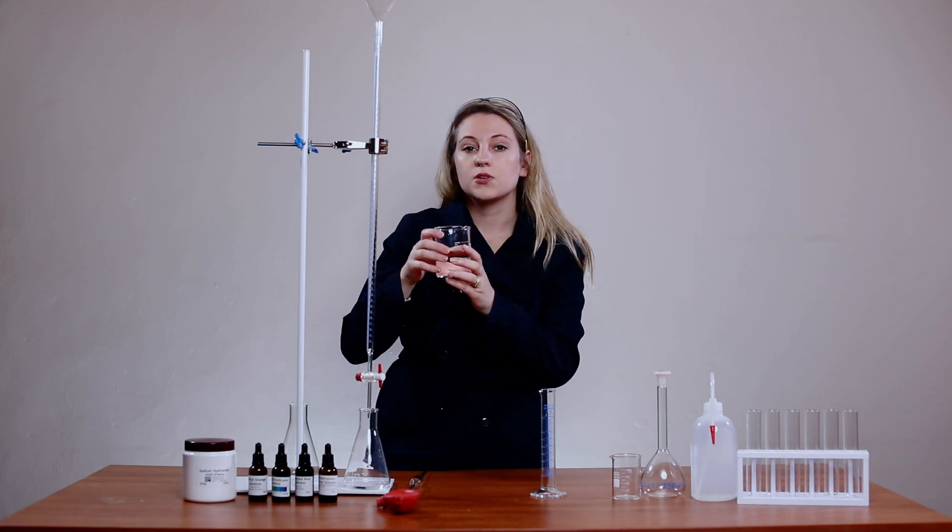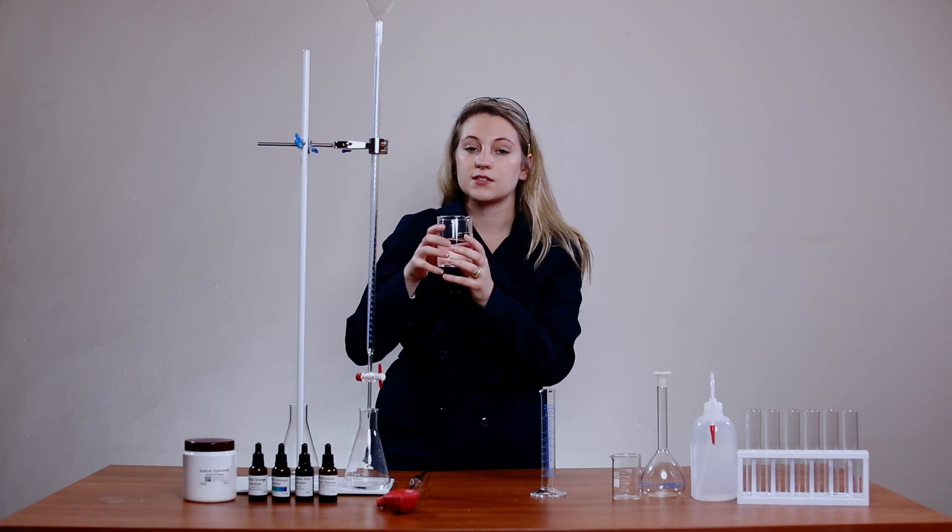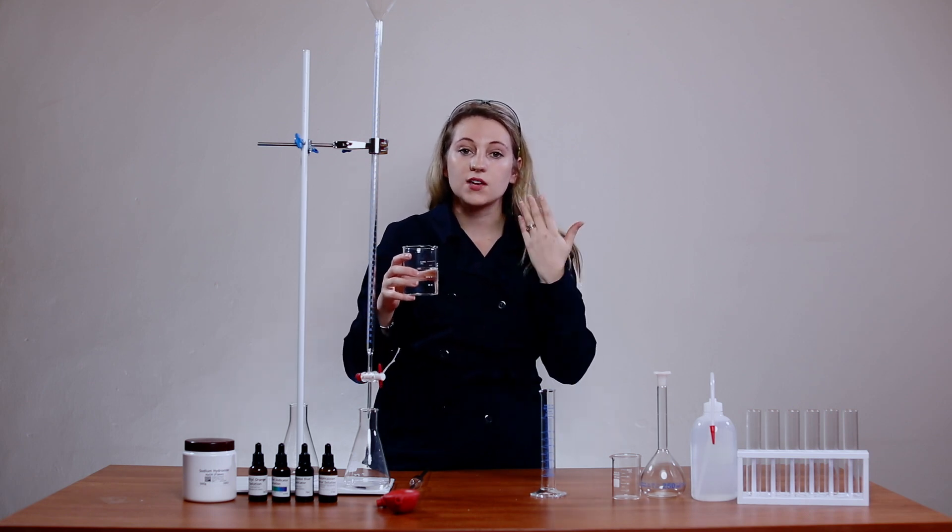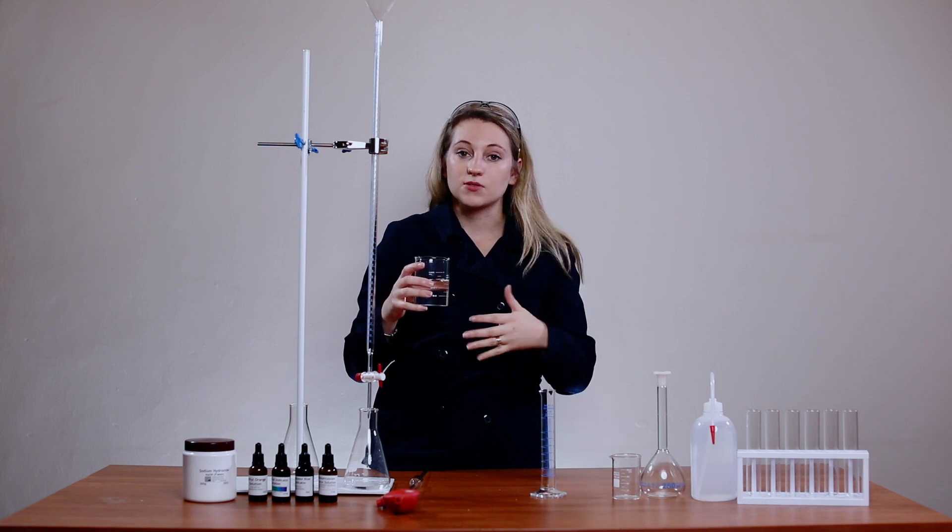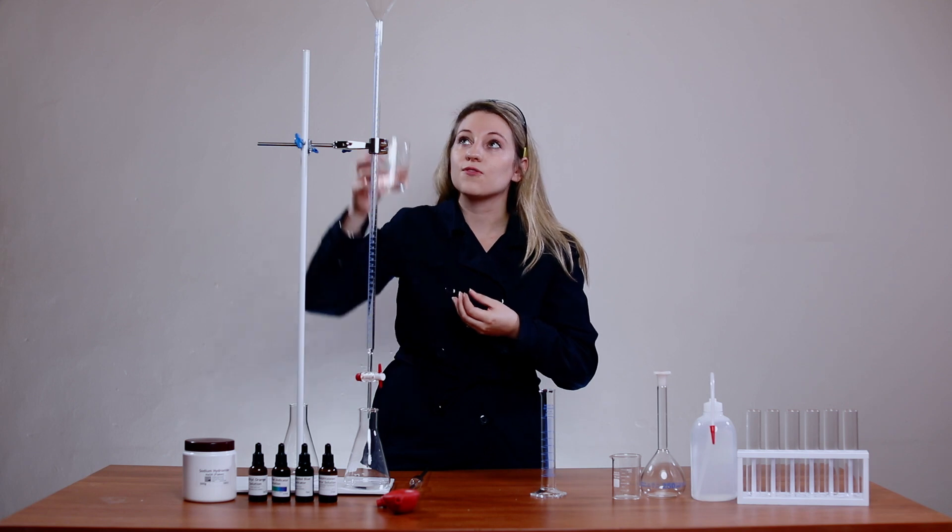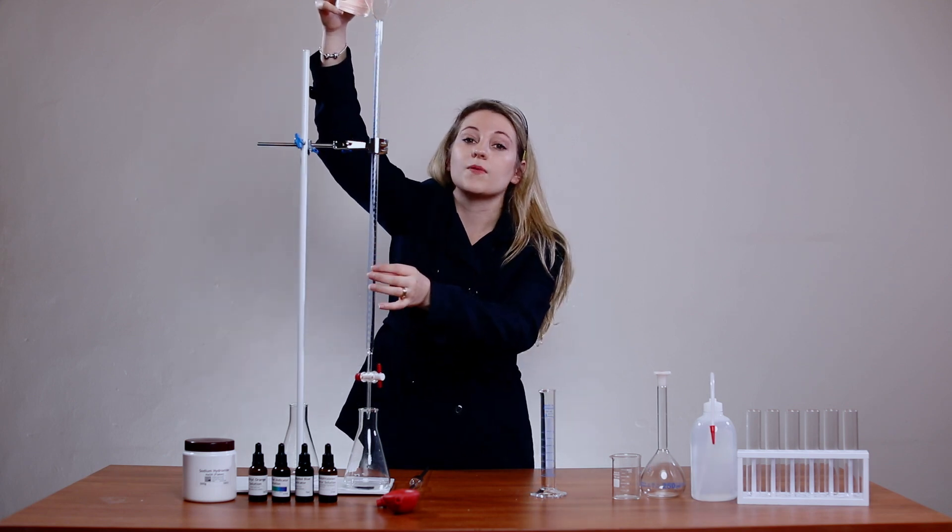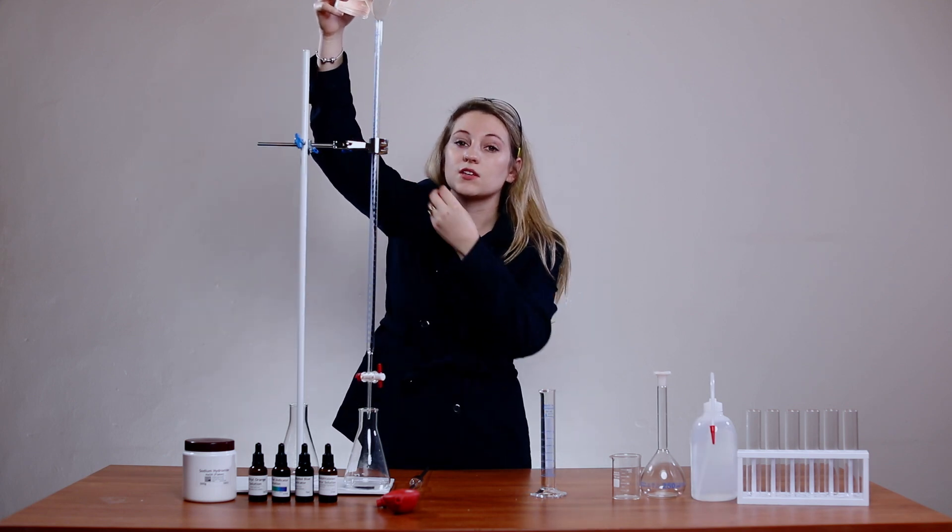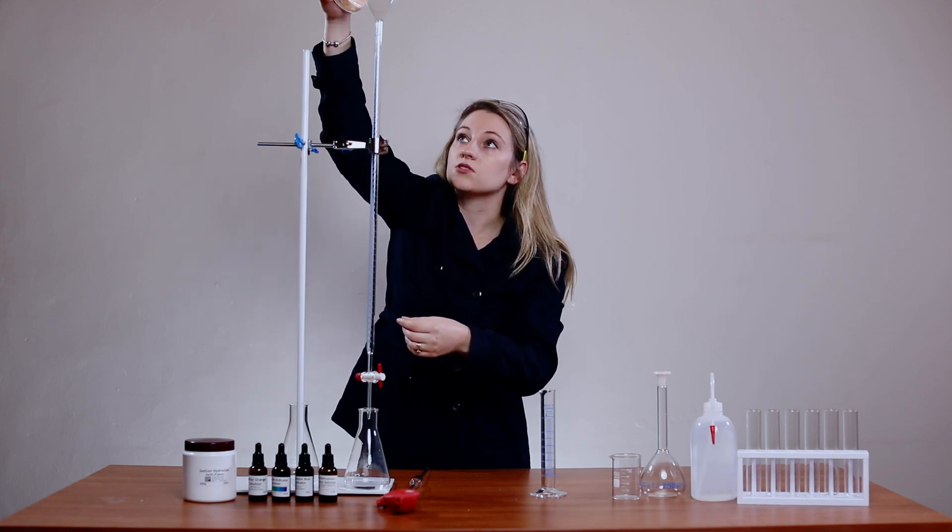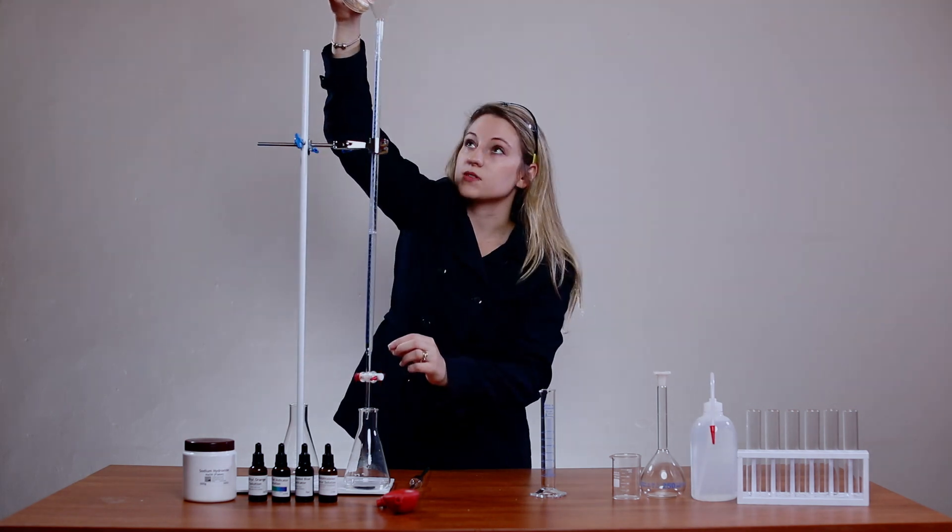When you work with acid guys, it's always important that you wear your safety eyewear and your lab coat or protective clothing because you don't want to spill this on you. If you can't reach the top of your burette make sure that you lower the burette. Make sure your tap is closed.